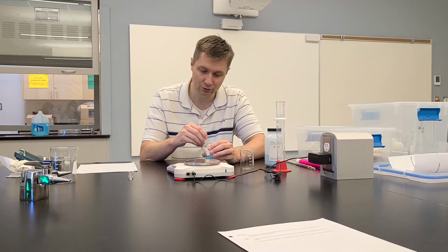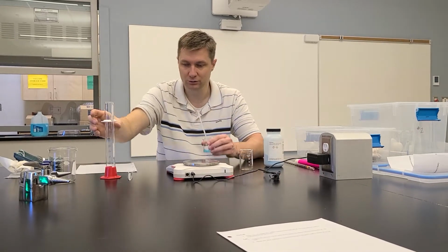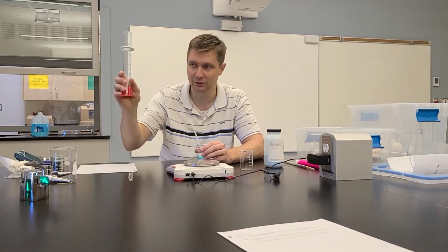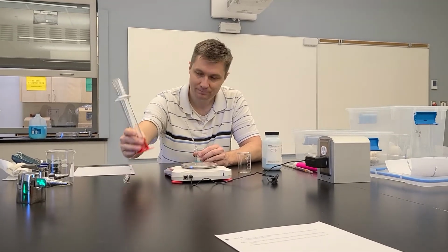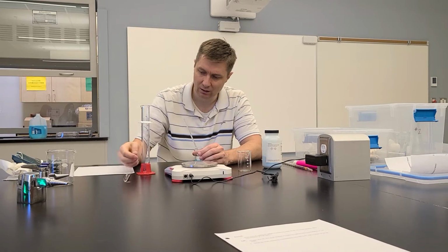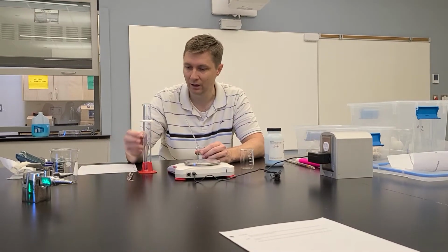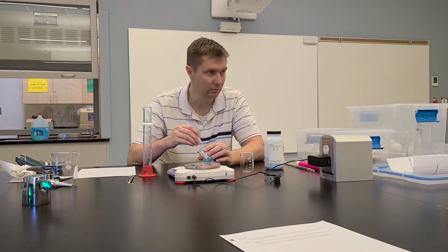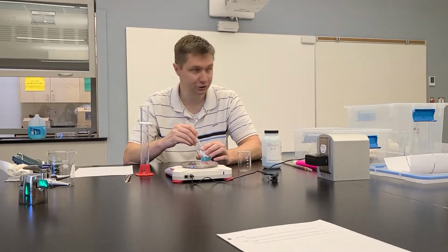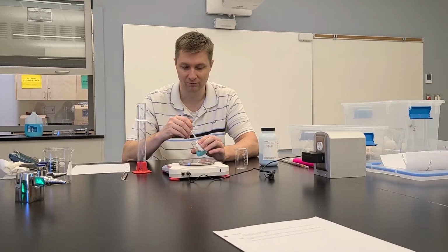And then once the crystals are dissolved, I want to pour the solution that I have in here into this graduated cylinder, and this is very accurate at measuring, okay? So I'll pour this in, it'll be somewhere below the 20 line, and then ever so carefully I'm going to pour water in here to bring this up to the 20 milliliter line. And that will be my stock solution. It'll be my 20 mLs with the concentration at 1 mole per liter, because I would have put in the correct number of grams of copper(II) sulfate for that, okay?